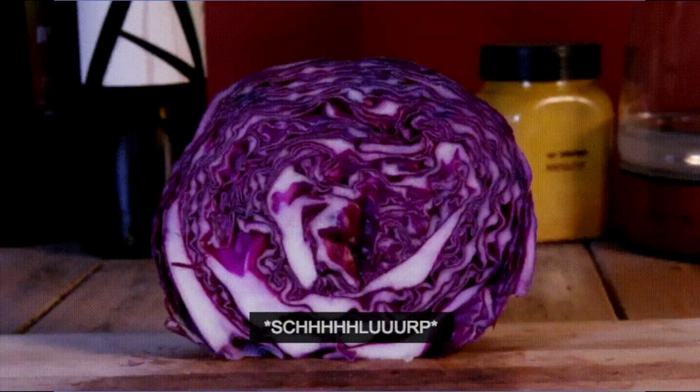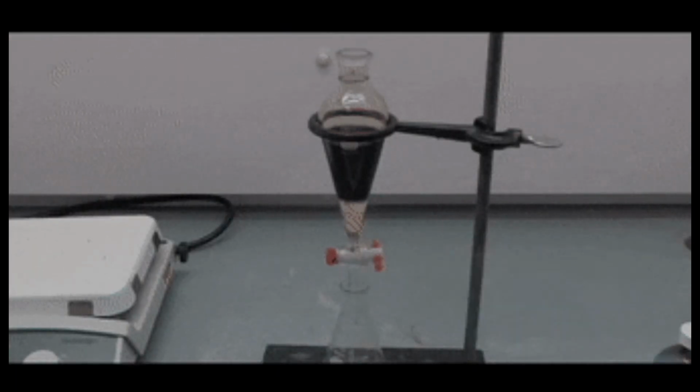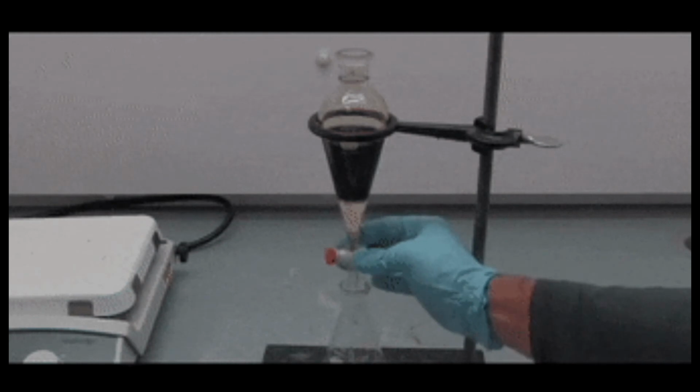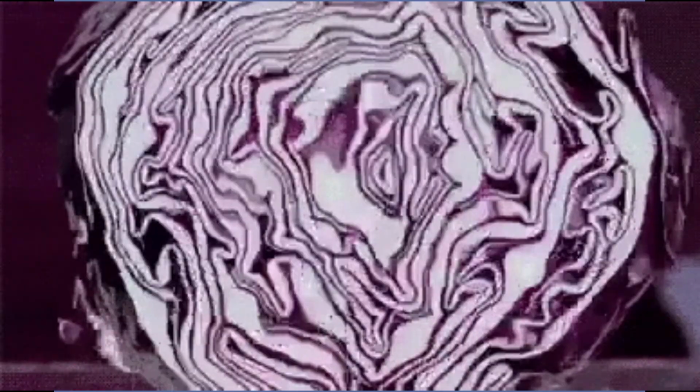The only important thing in this experiment is that we get color extract from eggplant, which in this case we would prefer to get more accurate and realistic results. But the best way to do this experiment is to use the red cabbage, because it will produce more of the color extract that we will need.